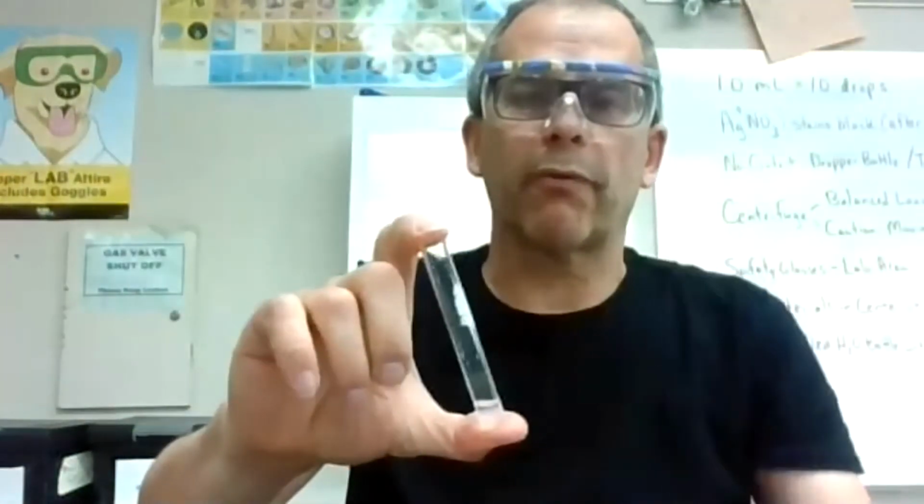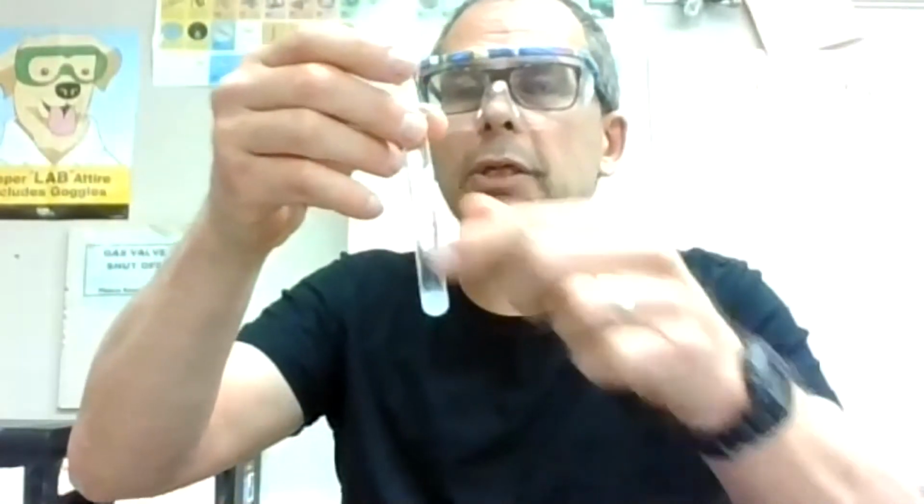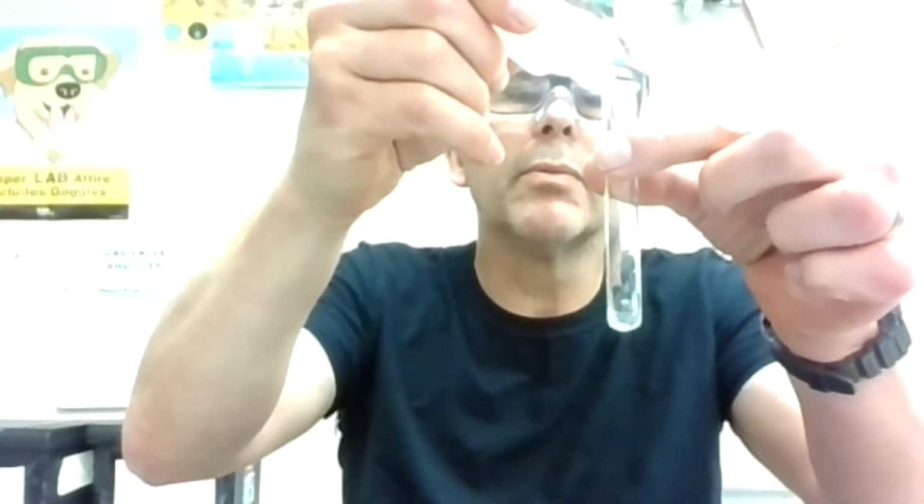And sometimes I do a quick flick of this thing and it almost looks like a gel. So it looks like there's little bubbles in there in a gel. So this is kind of a unique precipitate. Probably just looks cloudy to what you're seeing, but it's almost like I can look in there and see little bubbles and it looks almost like, I don't know, maybe like fish eggs going down the side or gooey, not really oily, but interesting. Okay, I'm going to add this to the next one, which is the calcium.